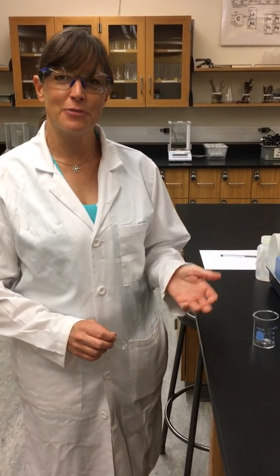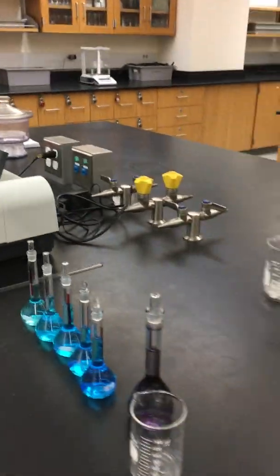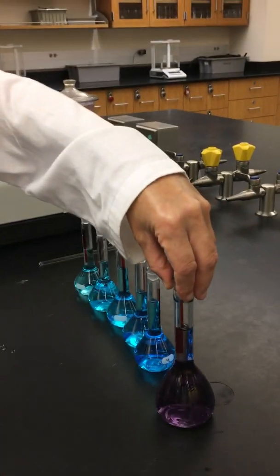Welcome back to experiment 10 part C. In this part of the experiment we're going to be measuring the absorbances of the solutions that we made previously in part B, so our dilutions, and also we'll be measuring the absorbance of our Kool-Aid mixture that we made in part A.